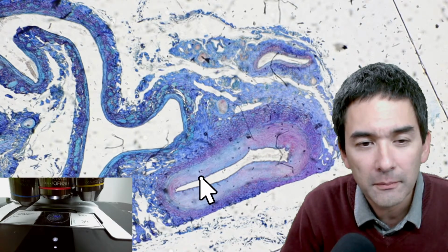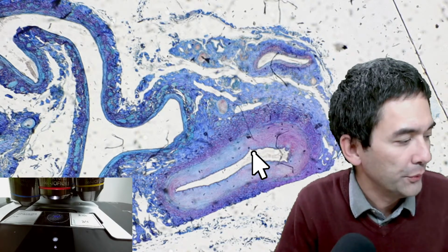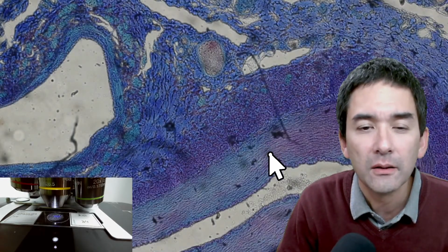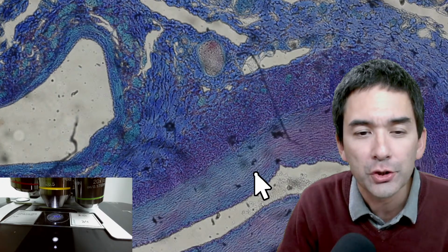But actually, when there's blood in there, it's of course round. So this is the 4 times. So let's go up a little bit with the magnification. Okay, so you again see that the wall of the artery is very thick to withstand the high blood pressure.